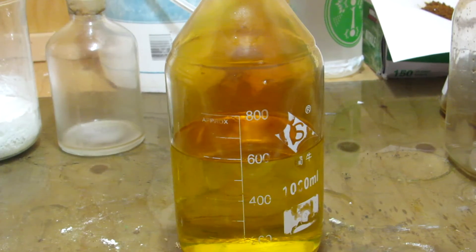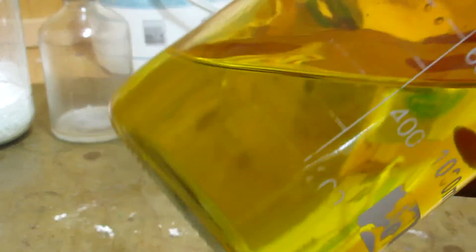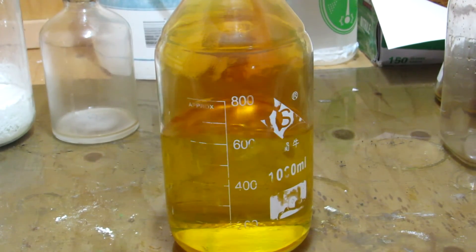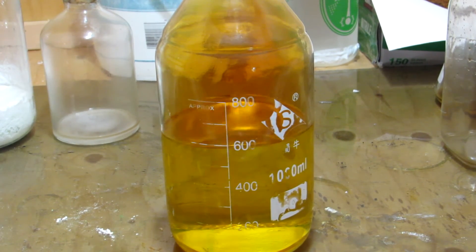So, after a few more batches, you can see that we got about 600 milliliters of our nitric acid. This was done after doing four more runs with the exact same reactants, and finally, I used up all that old sulfuric acid, which was my goal.